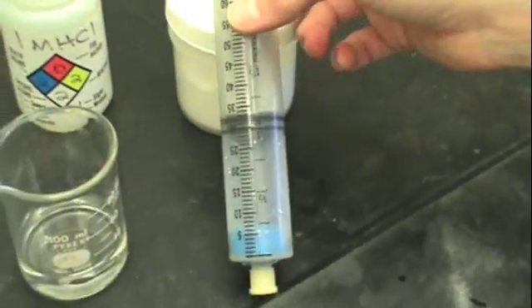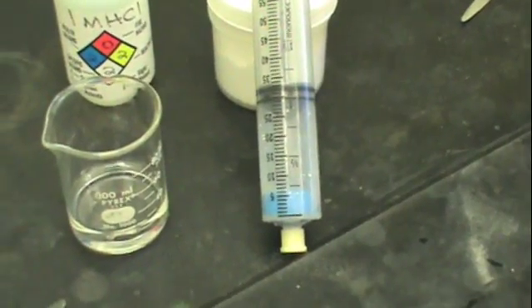Once you've gotten your final syringe reading, repeat this process with different masses of sodium bicarbonate.